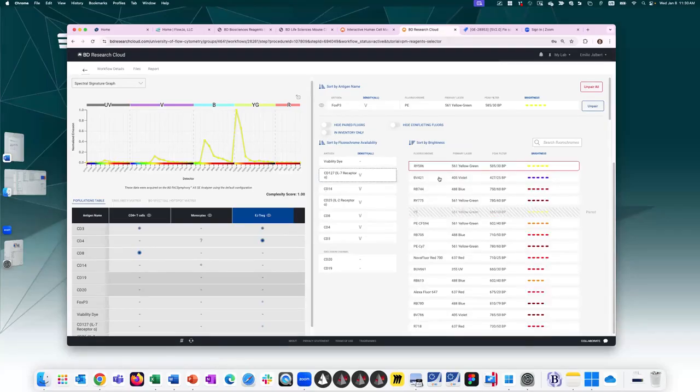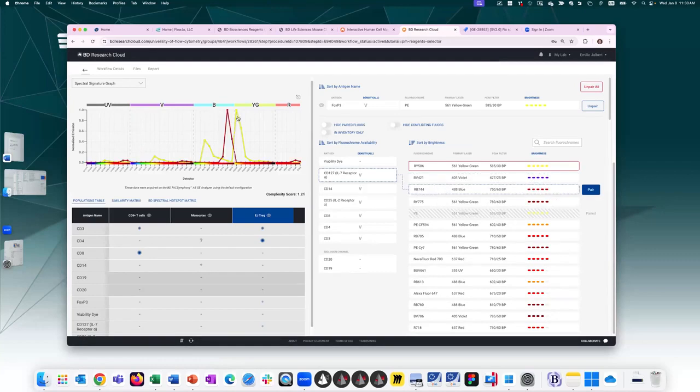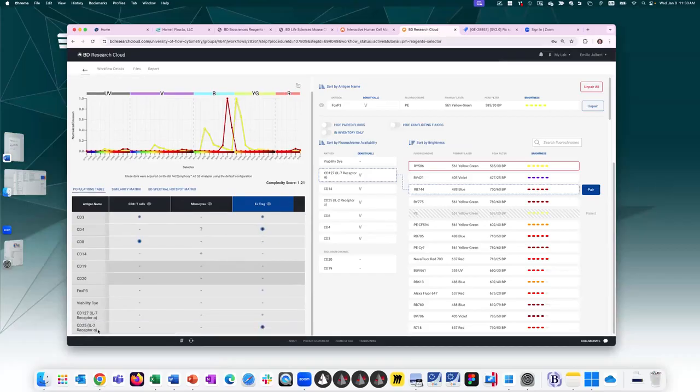So as I add other fluorochromes, I get to see the interaction with my previous pairings. So if I move down the list based on fluorochrome availability, CD127 is next. And if I look at my table at CD127, I can see that it too has a low antigen density. So I'll want to assign a bright fluorochrome. Now that I've paired PE already, CD127 comes available in PE, but it's hashed because I've already paired it.